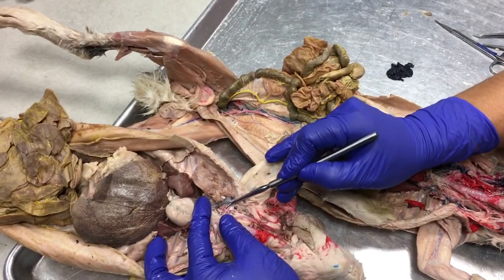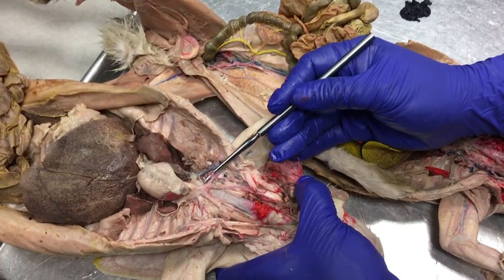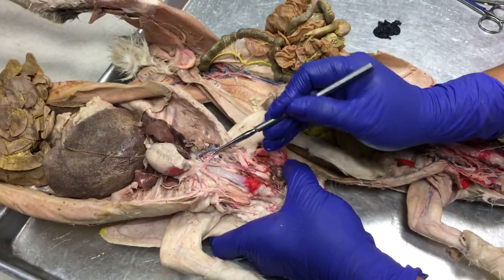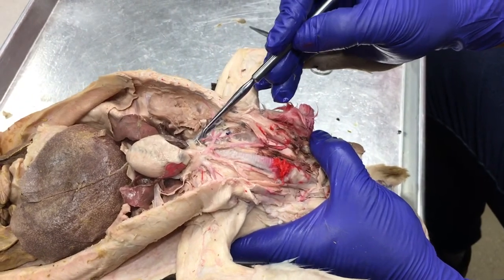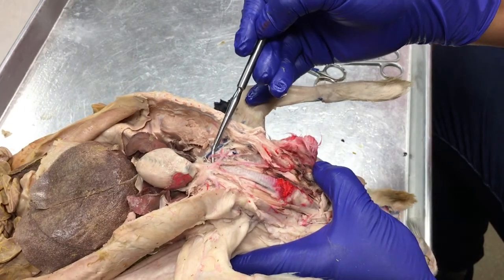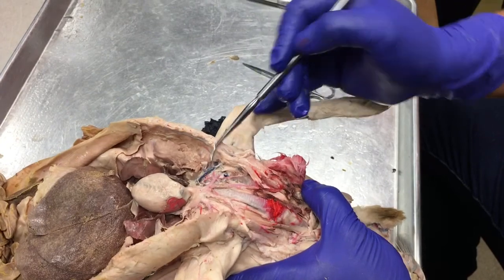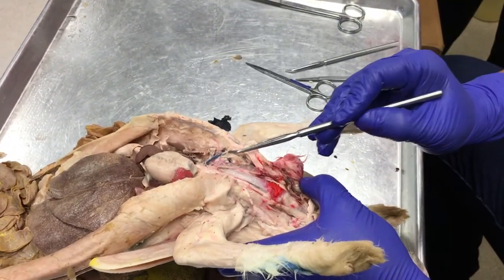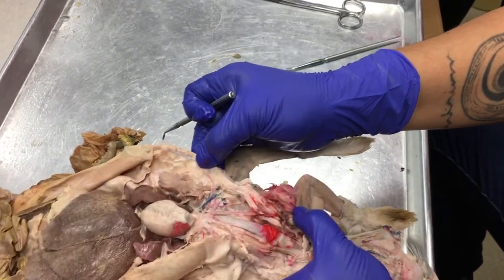Here are the 2 posterior tributaries that are branching off right around the same area as that costocervical trunk artery. Okay, so these 2, if I follow this one, it goes toward the medial area behind the heart. It's going toward the spine. This is the vertebral artery. This one, look at it, goes all the way out to the chest wall here. This is the internal mammary artery. Okay, so it's serving all the mammary gland areas.